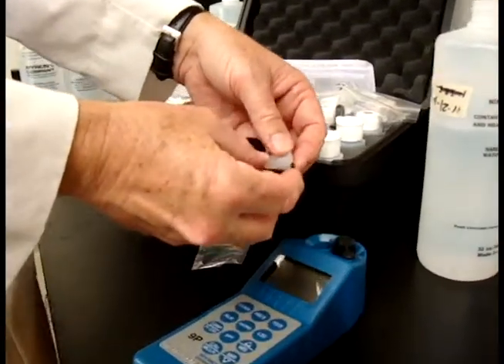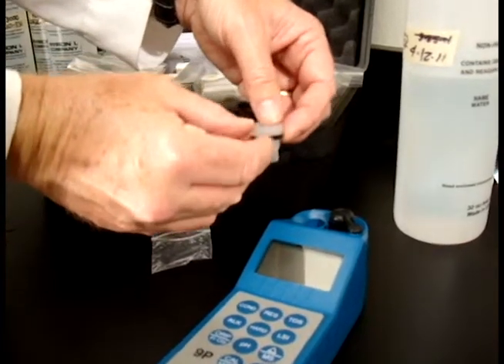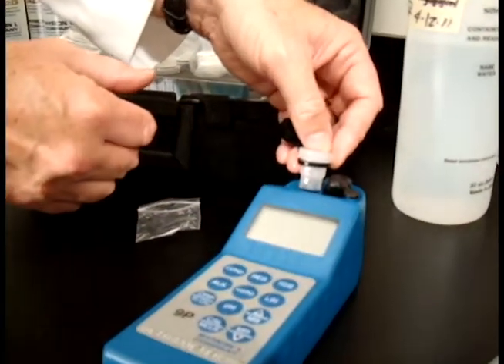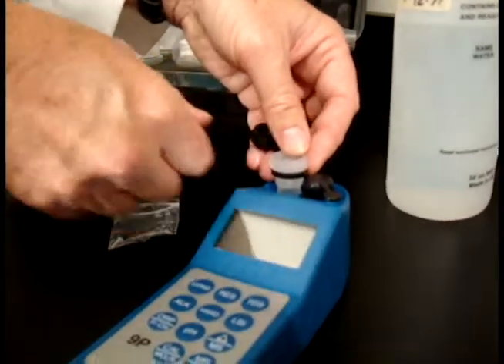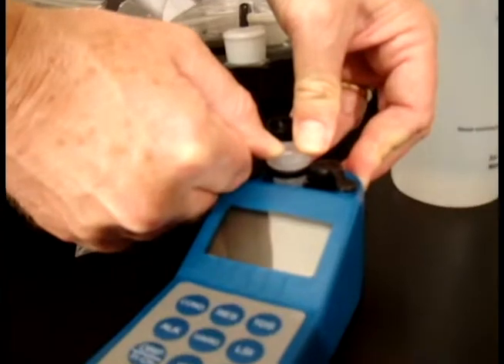Now when you go to install it, make sure the ring of this is up next to the shoulder of the cell extender. Center it in the cell and from both sides, push straight down and seat it as far down as it will go.